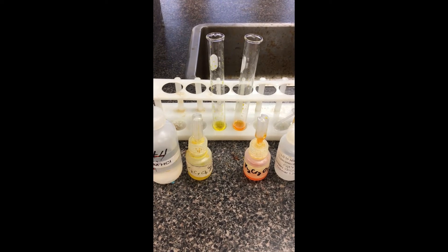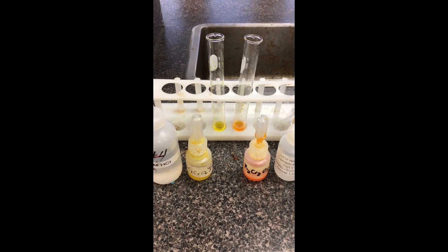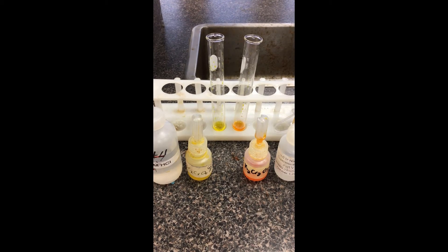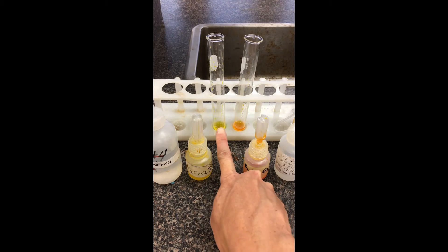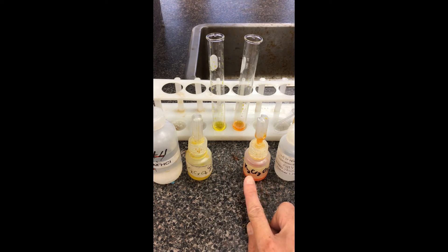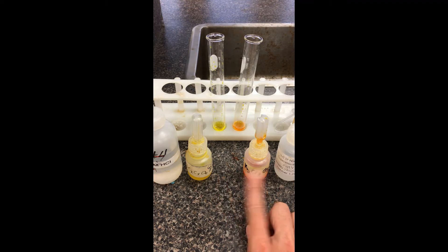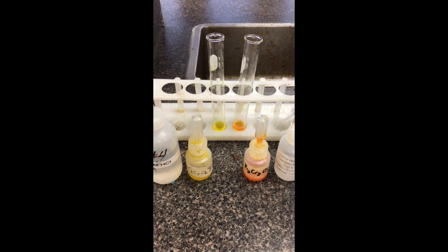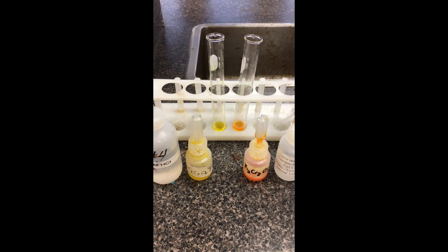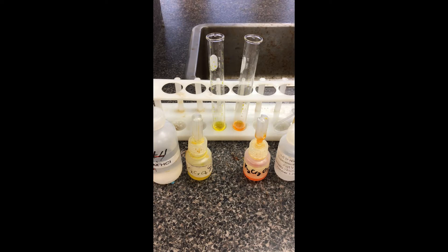For station 4 of our equilibrium lab, we're going to be investigating the chromate-dichromate equilibrium. We're starting off with potassium chromate, which is a yellow color already filled in the test tube. The orange color one is potassium dichromate. These are actually involved in the same equilibrium system, and we're just investigating which one we put in first.